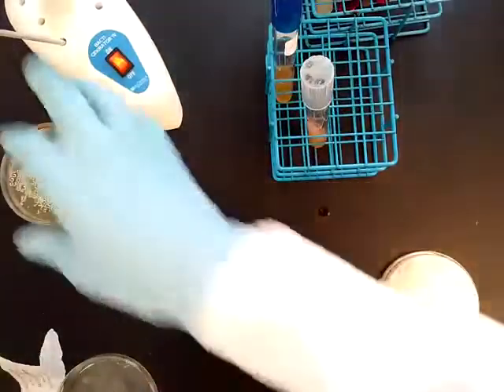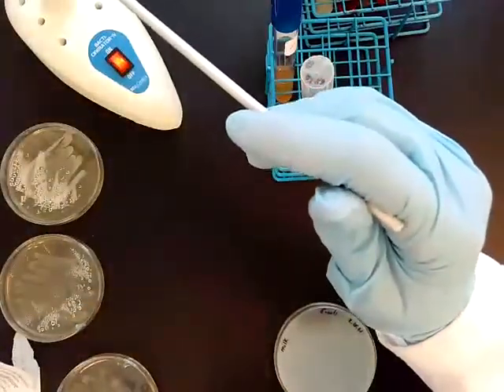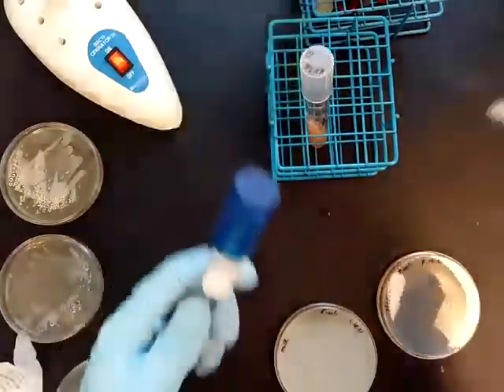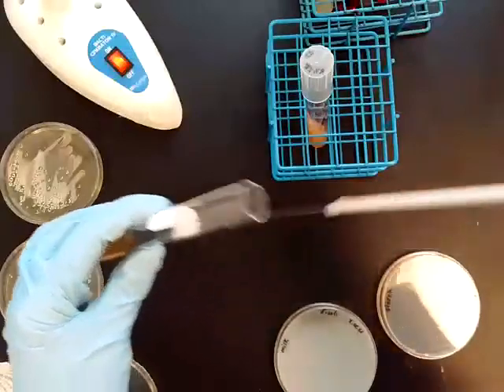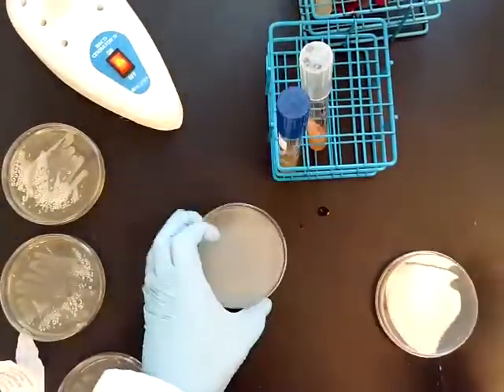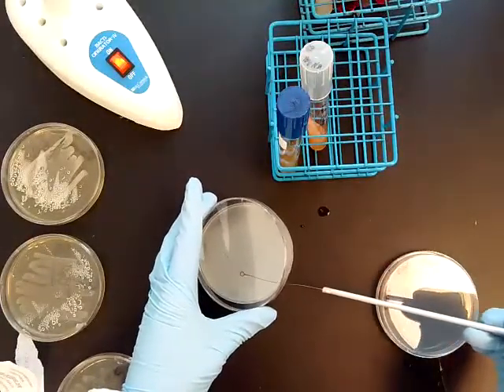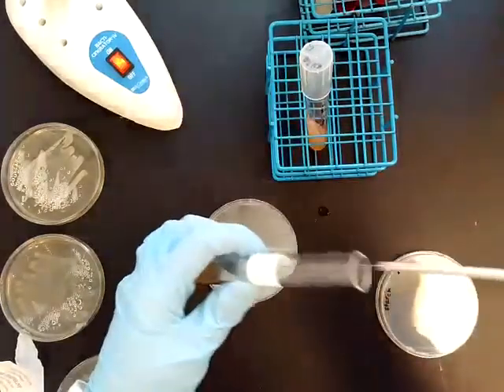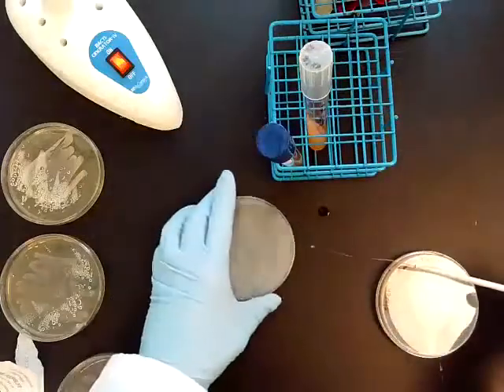Now that they're all labeled, I'll flame sterilize my loop. I'm going to grab an E. coli broth culture and aseptically transfer some bacteria to the plate. I'm just going to draw two lines down the plate — there's one line, then I'll grab some more bacteria for the second line.